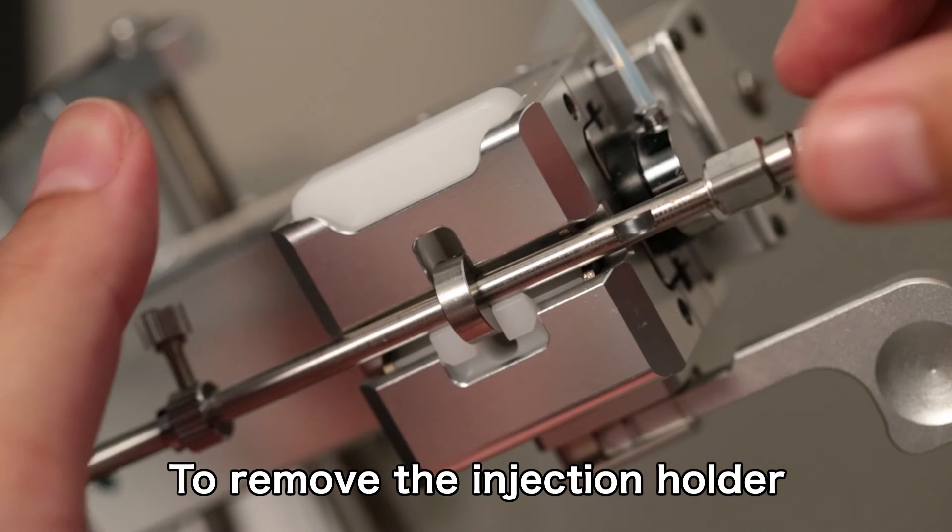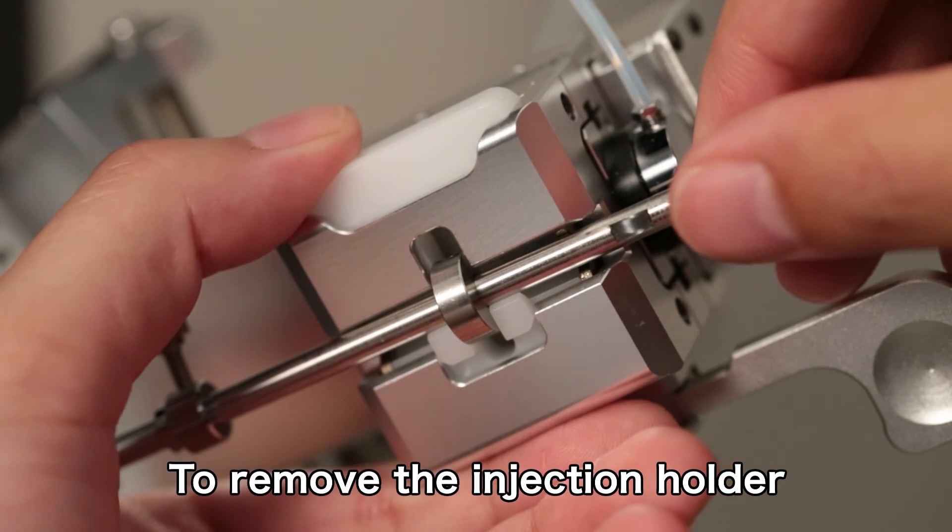To remove the injection holder, press the detach button and release it.